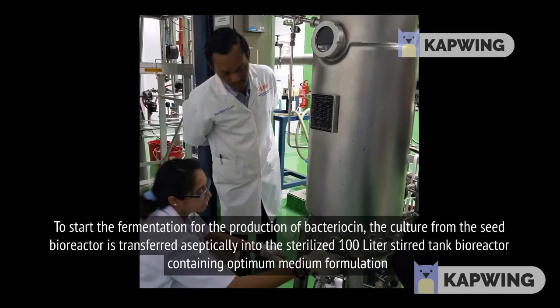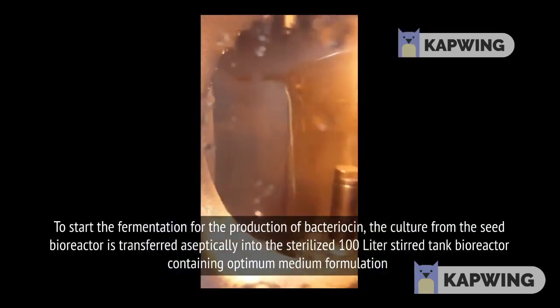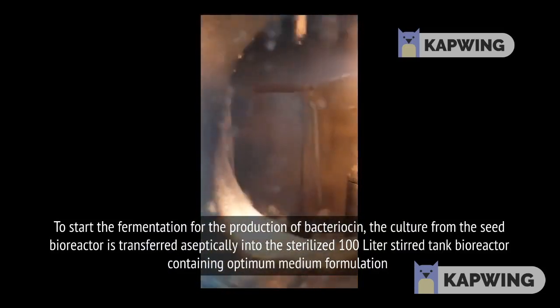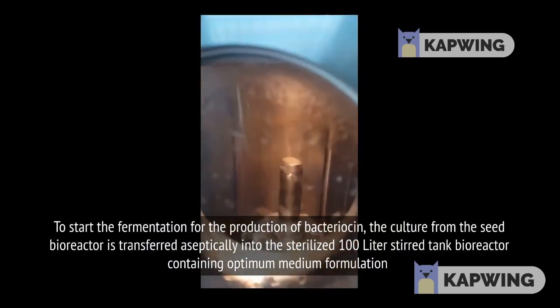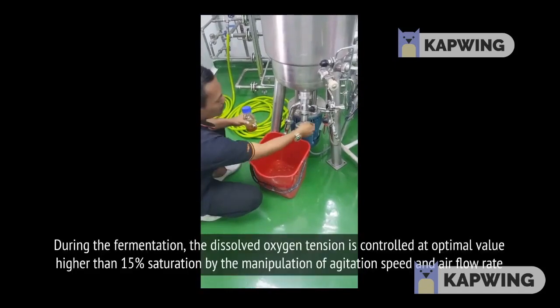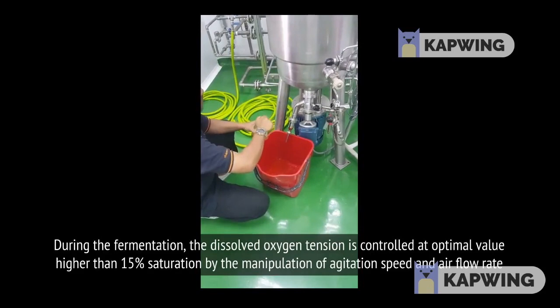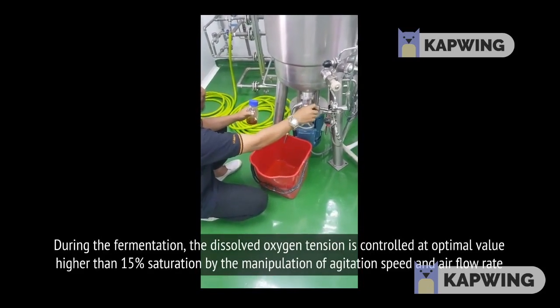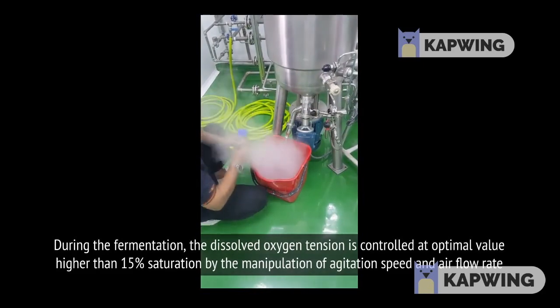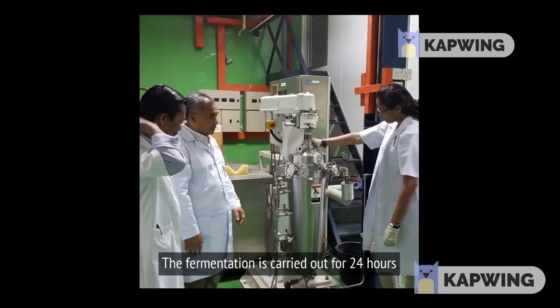To start the fermentation for the production of bacteriocin, the culture from the seed bioreactor is transferred aseptically into the sterilized 100-liter stirred tank bioreactor containing optimal medium formulation. During the fermentation, the dissolved oxygen tension is controlled at an optimal value higher than 15% saturation by manipulation of agitation speed and airflow rate. The fermentation is carried out for 24 hours.